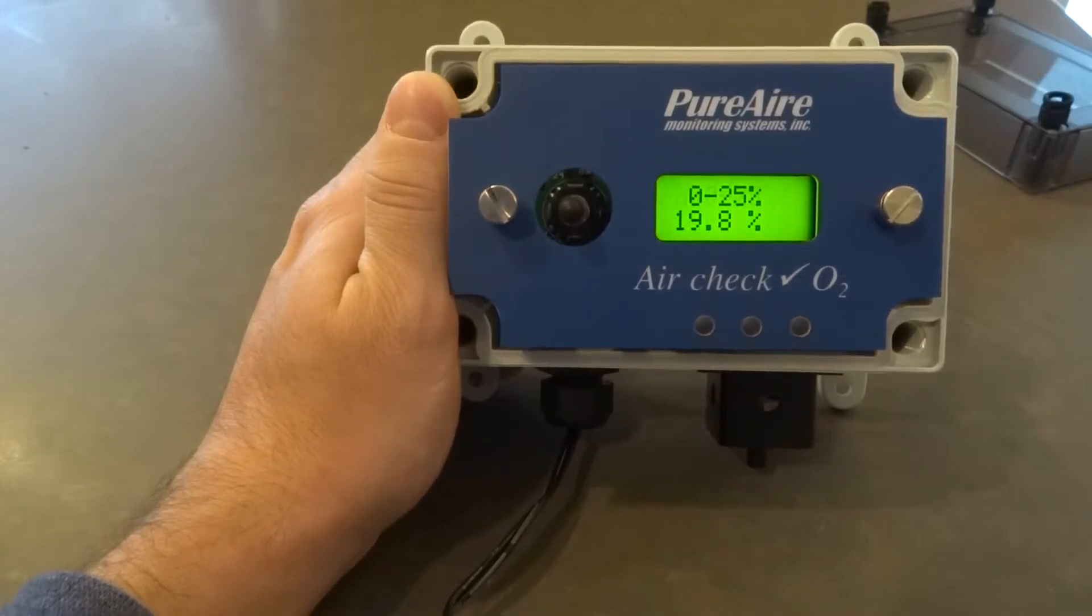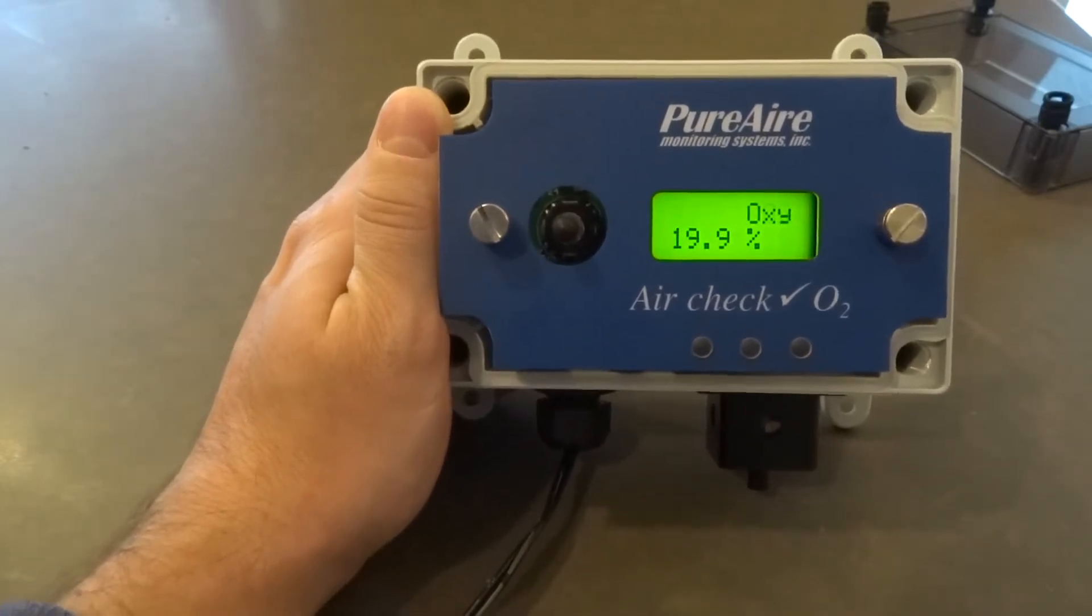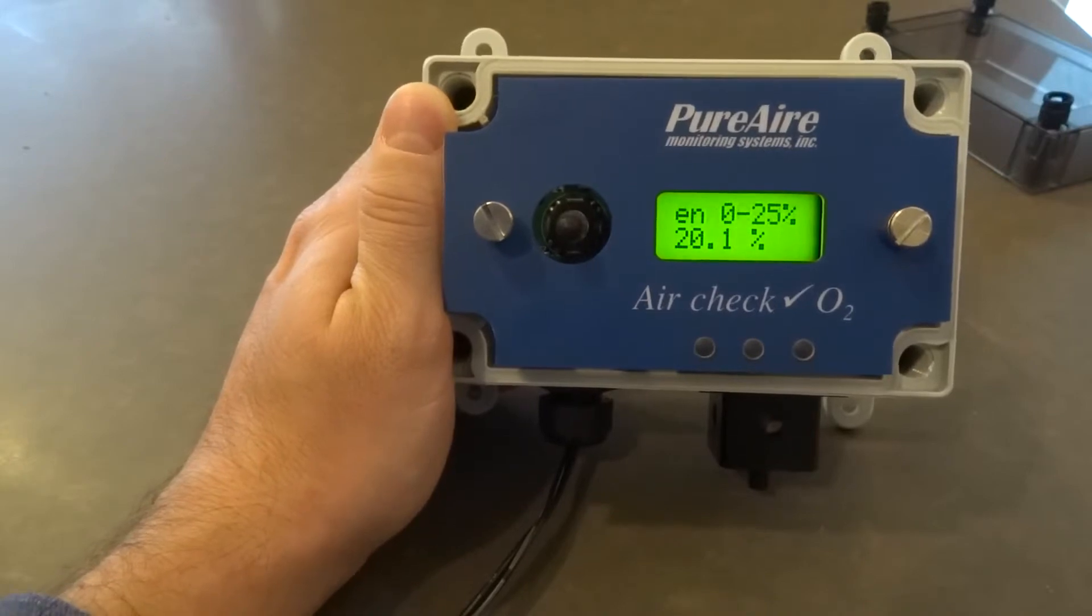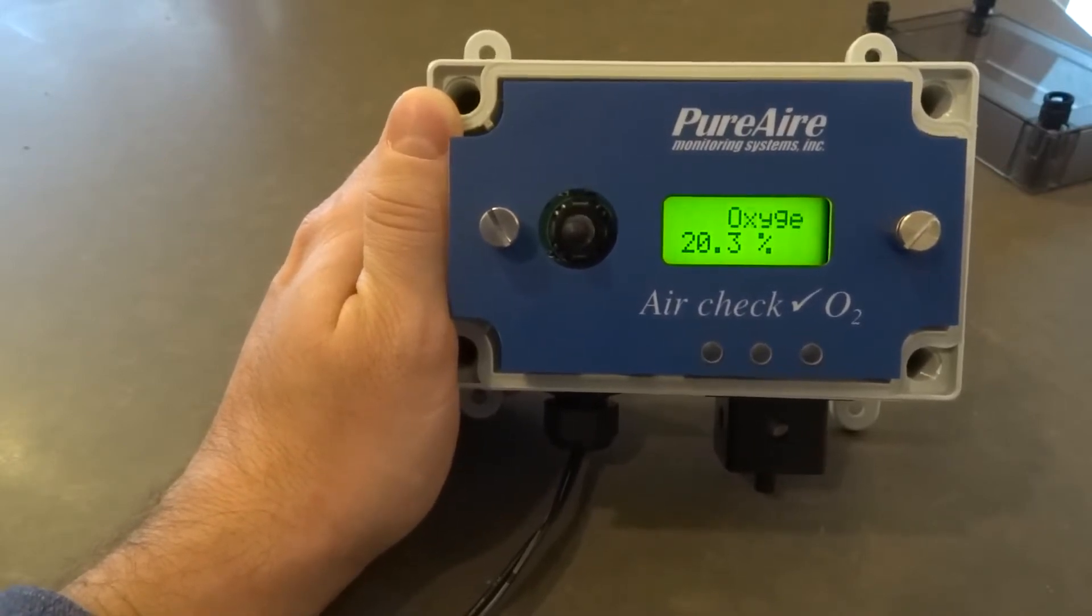As you can see, the sensor responded very quickly and now it is going back to 20.9.